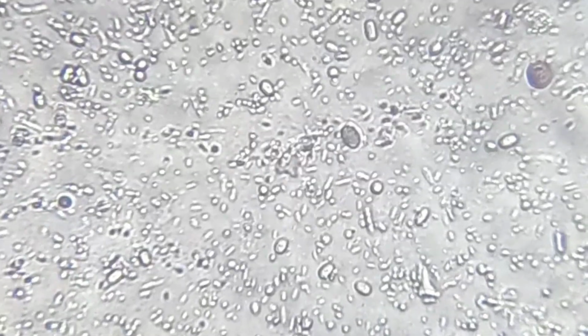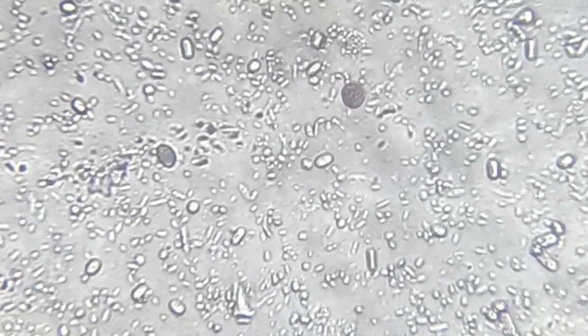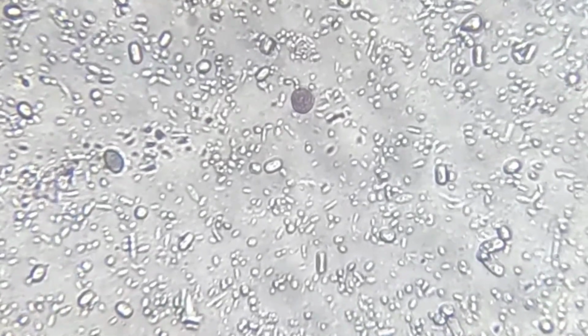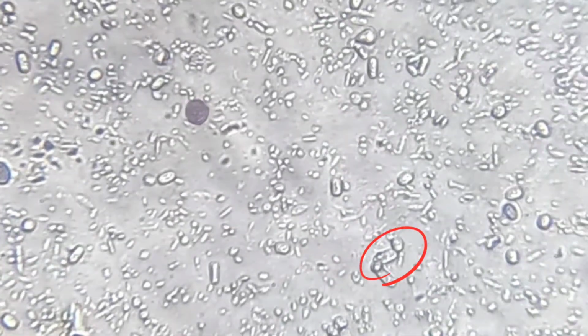The first thing that immediately catches my eye is the presence of large oval shaped cells. These are much bigger than everything else around. They look like tiny transparent eggs or small grapes inside the microscope. Many of them have a smooth outline, and some even have a small oval shape attached to it.